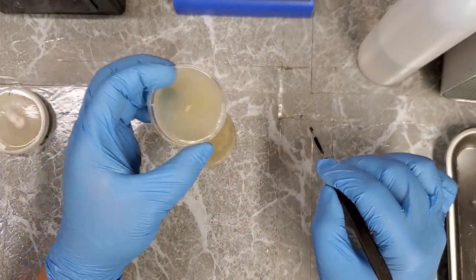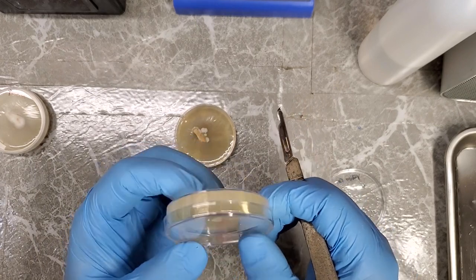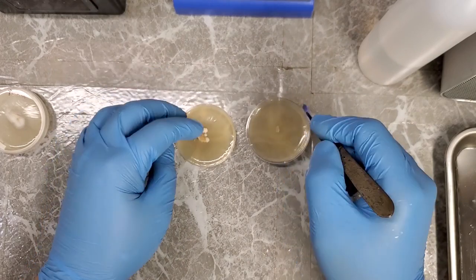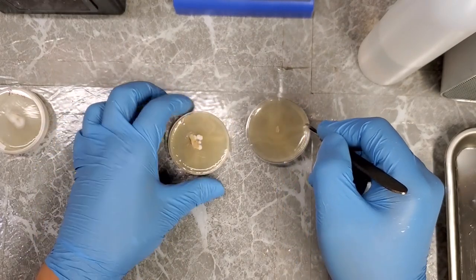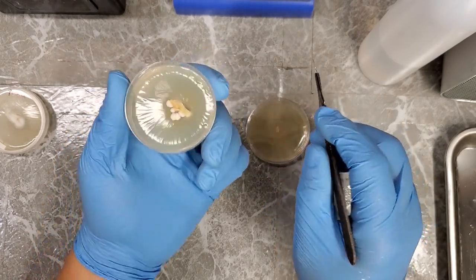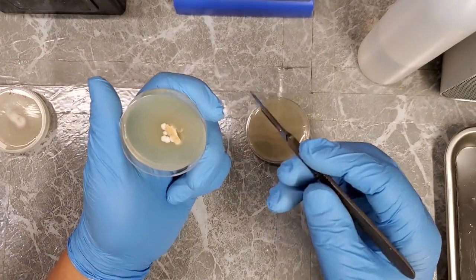That's really all you have to do. I don't think it's really going to come through on camera. There is some mycelium on there. Let's just use this petri dish as an example. So I'm not going to really worry about this guy growing. And I just touched the freaking agar. I forgot that the lid was off of this. I'm not used to that. But anyway, I'll show you another transfer.